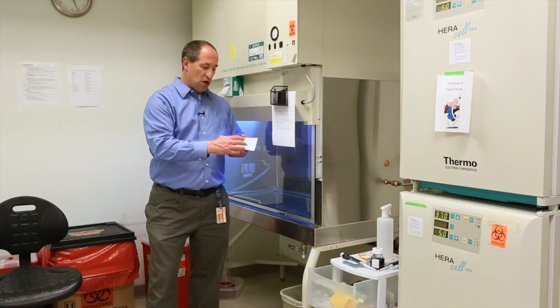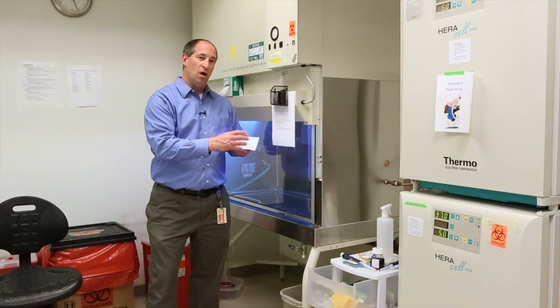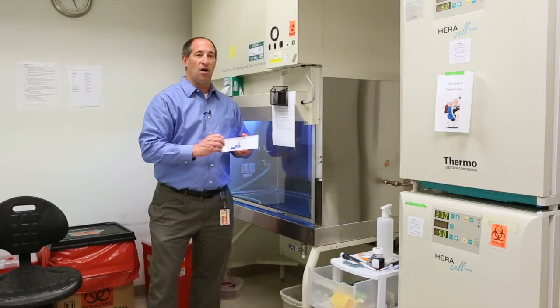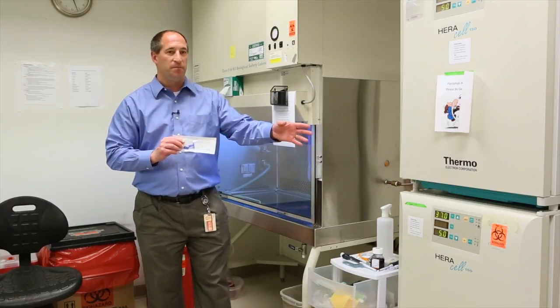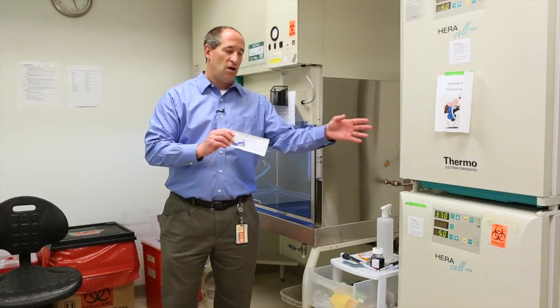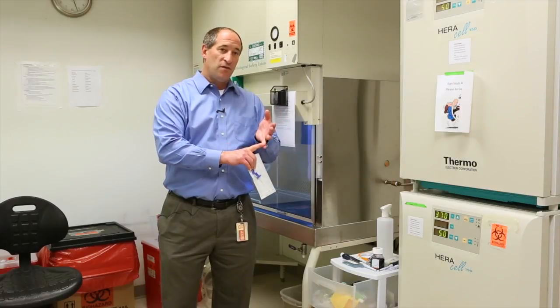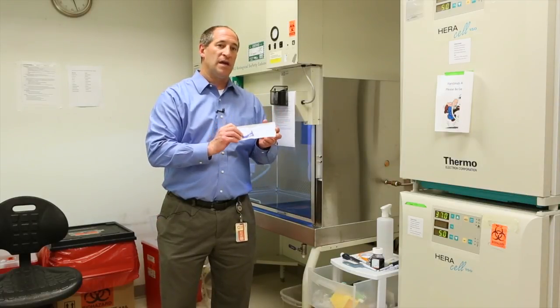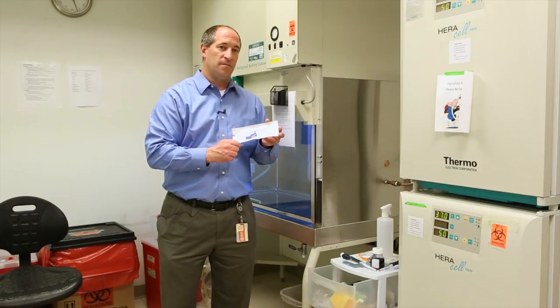We then take that out, put this tube into a conical tube and rotate it inside our incubator which is right here. We need to keep track of the number of cells added, the volume of cells added, and how long we incubate those cells in the sleeve.